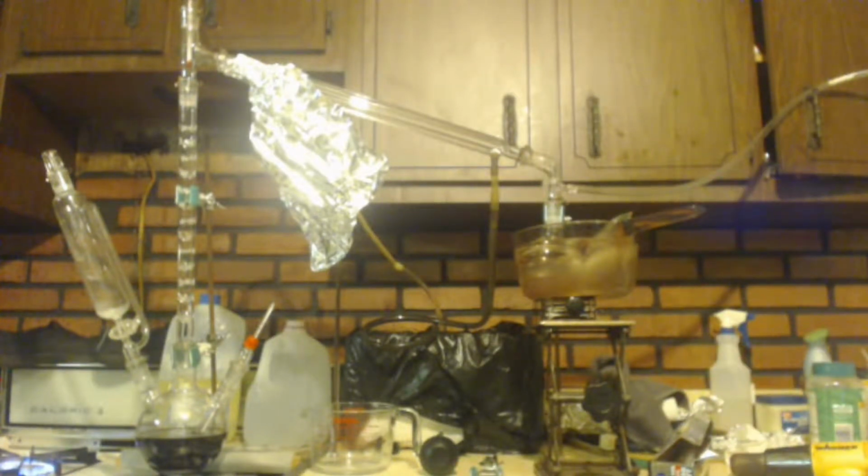So what I'm going to do is take this over to where the fume hood is at. Because of the ventilation and all that, the fans, it's hard to hear me. You might have to turn the volume up. So I'm basically starting out adding, because I still have more of that hydrochloric acid I need to add, that third of a mole.